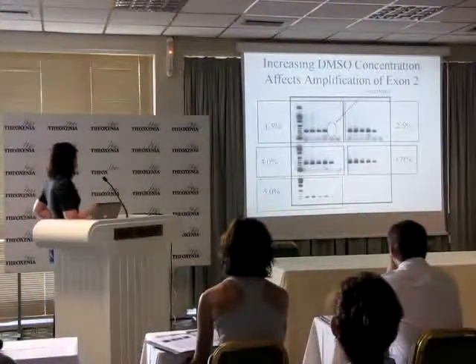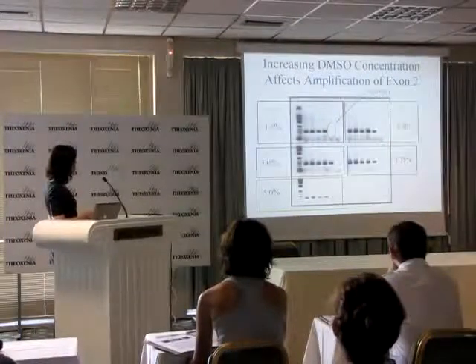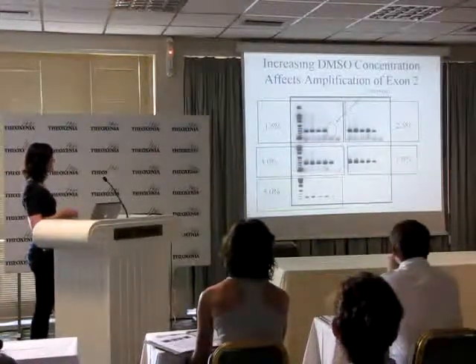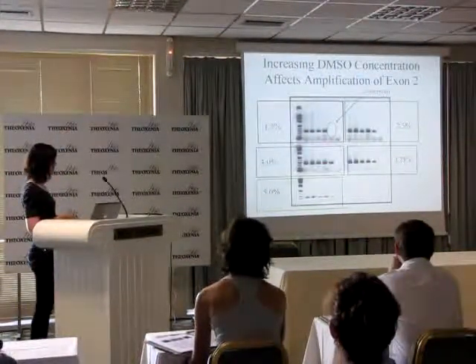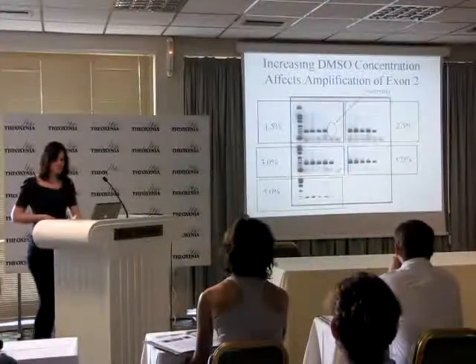Initially I was using 1.5%, and then I tried 2.5, 3, 3.75 and 5. As you can see with the 0301, which did not amplify at 1.5, you can see the product as a faint band and then a stronger band at 3%. So I sequenced everything except the 5%.